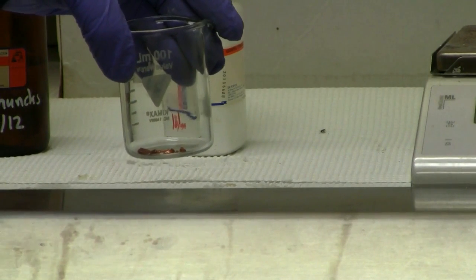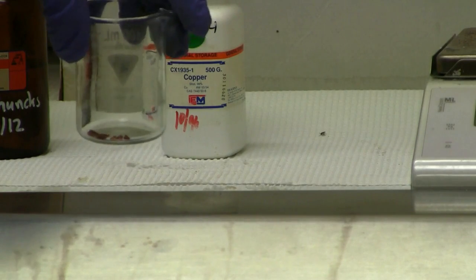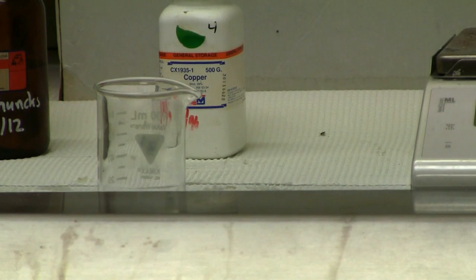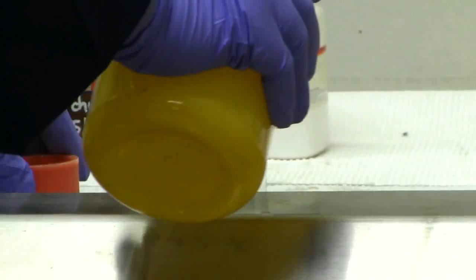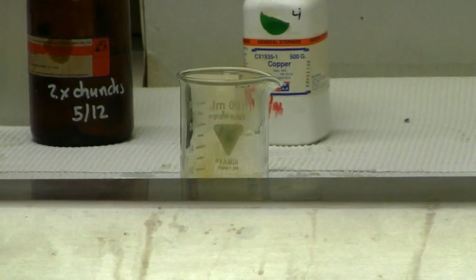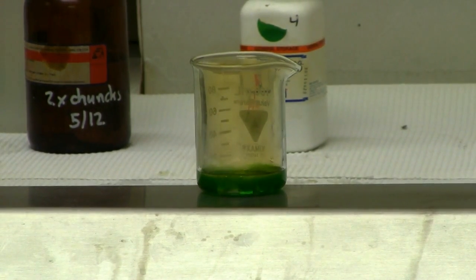So what we have here is copper shot. And what we're going to do is we're going to expose the copper shot. Copper is a strong reducing agent or reducing metal. Most of your metals are. And we are going to expose it to a strong oxidizer, also known as nitric acid. Now, what this does is it produces nitrogen dioxide gas, as well as a few others, and copper nitrate, copper 2 nitrate.